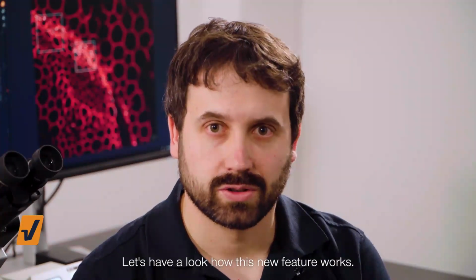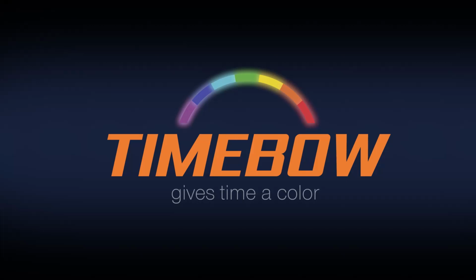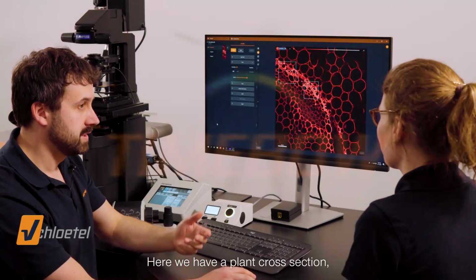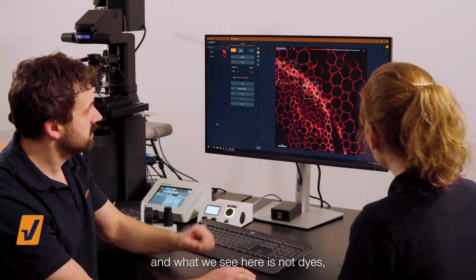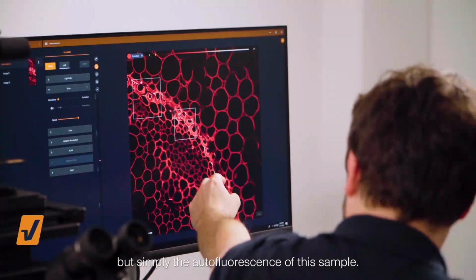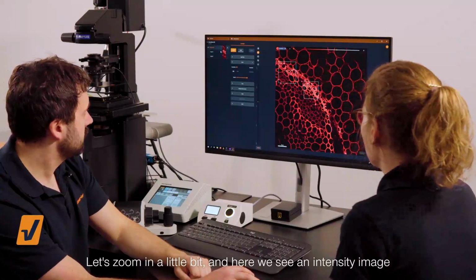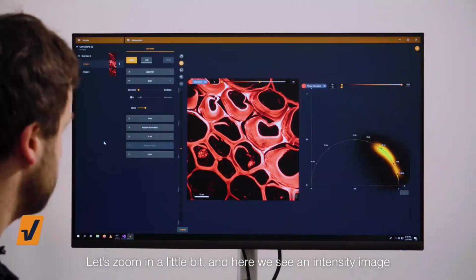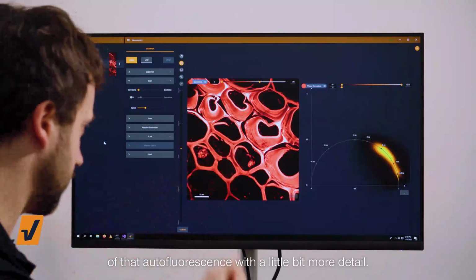Let's have a look how this new feature works. Here we have a plant cross-section. And what we see here is not dyes, but simply the autofluorescence of this sample. And that by itself can be very interesting. Let's zoom in a little bit. And here we see an intensity image of that autofluorescence with a little bit more detail.